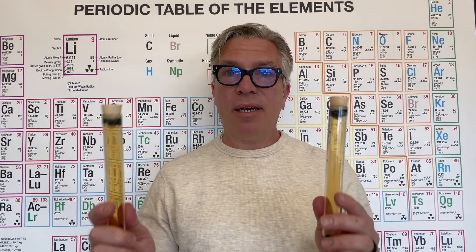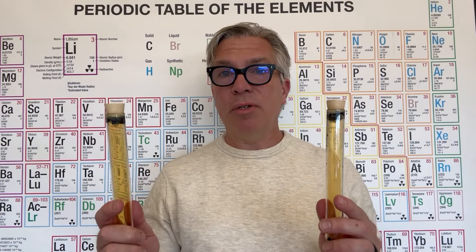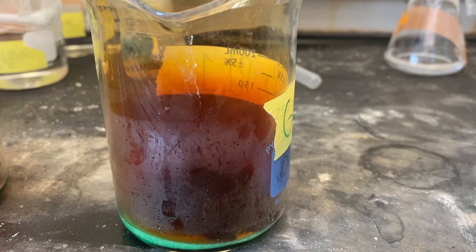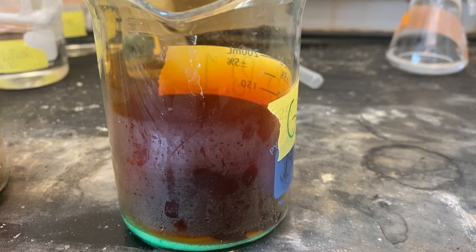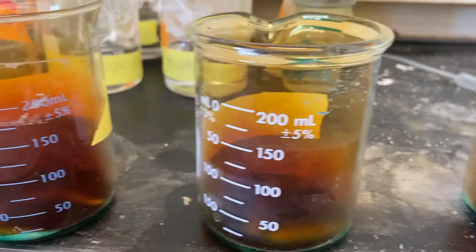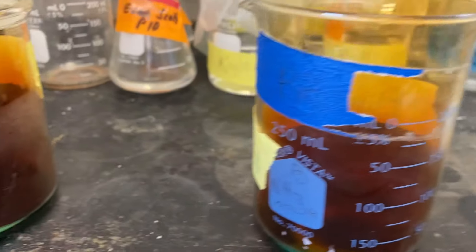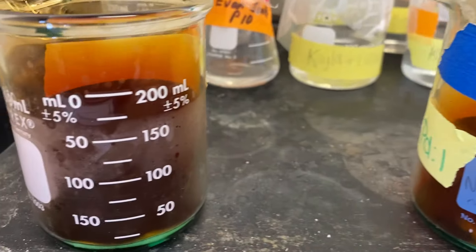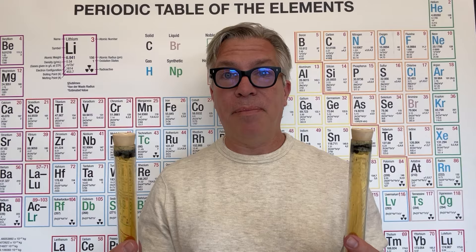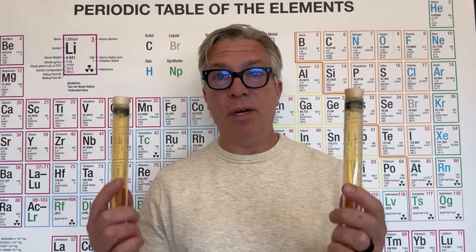Each of these test tubes contains nitrogen dioxide gas, which I produced in the fume hood using the reaction of copper and concentrated nitric acid — a reaction similar to the reactions of copper video I posted a while ago. I'm going to put one of these in hot water and one in cold water and let's see what happens.